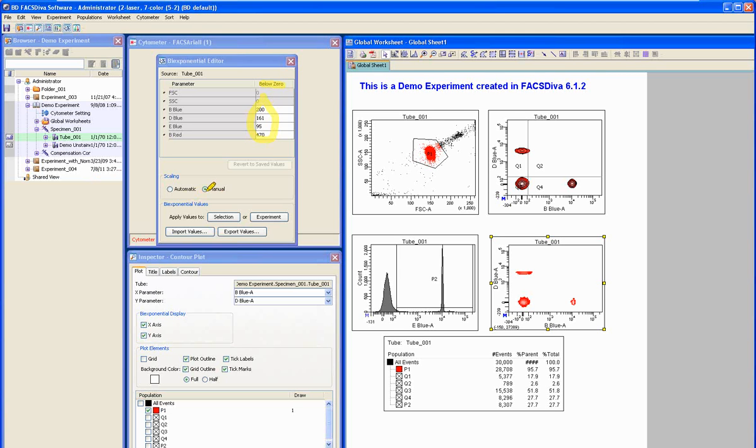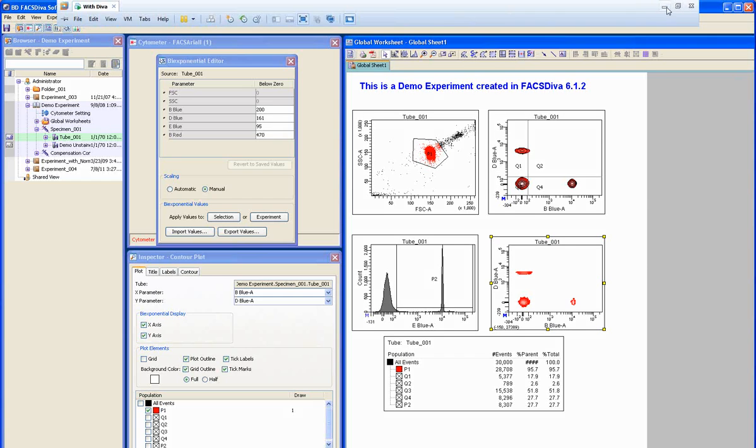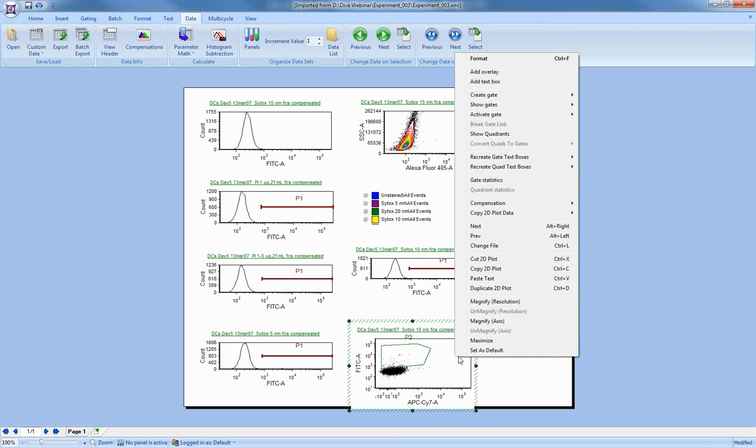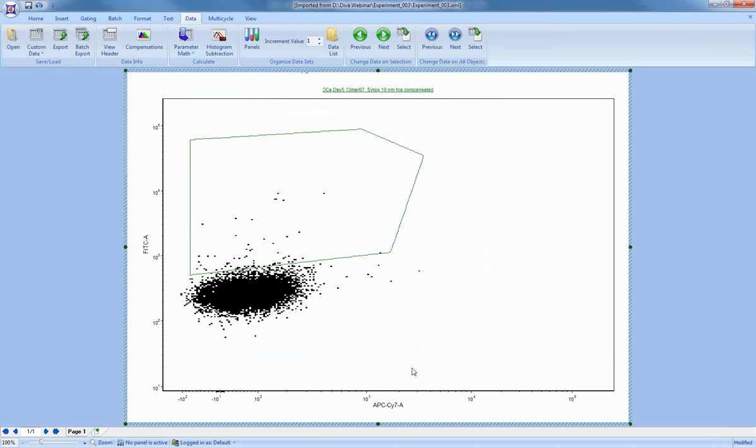You can also change these. They can either be on automatic or on manual. In FCS Express, we have something similar, except that instead of operating on the entire data file, it operates on a plot by plot basis. So you can change the settings by plot if you needed to. What I'm going to do on this plot is maximize it to make it a little easier to see. This is not the same plot, but the same principle applies.